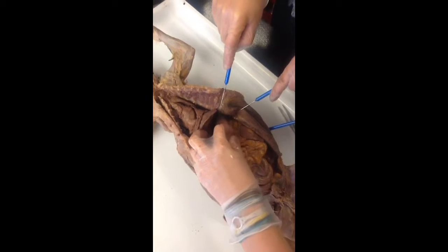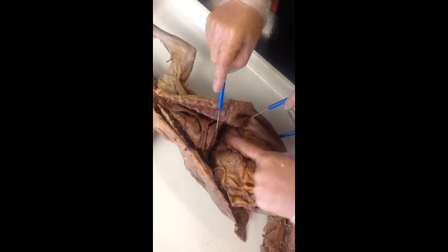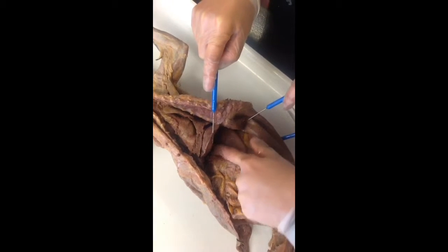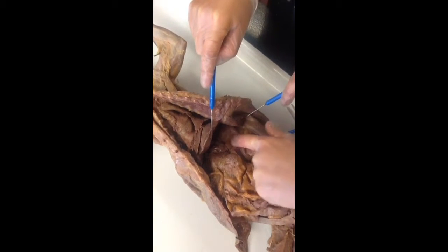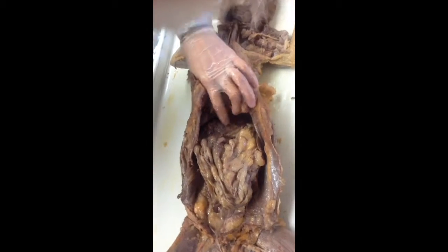So this is your stomach, right? Do you see this stuff right there? See that white stuff? It's kind of hard to see on yours, but this is the lesser omentum, because do you see how it looks like the same tissue as this? Here, come with me and look at the cat. So greater omentum, right? And then in here, do you see all this white stuff? You just don't really have a lot. But see how all of this looks like the same tissue as that? That's the lesser omentum. So you always know it's between the liver and the stomach.